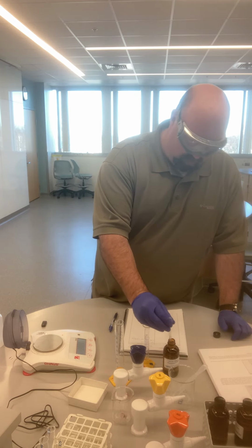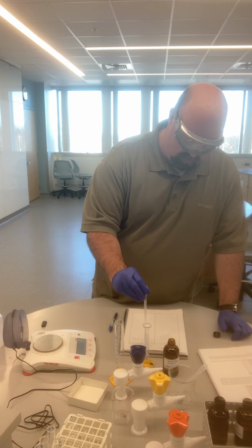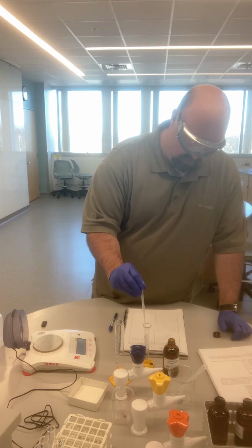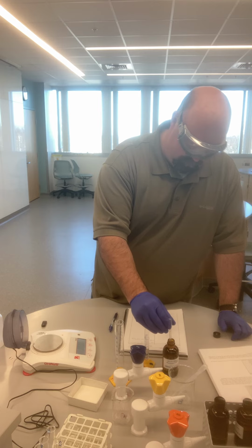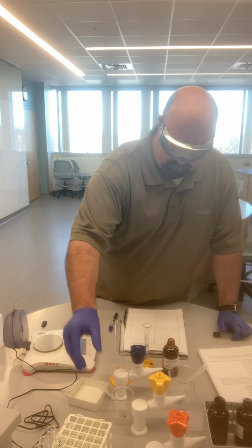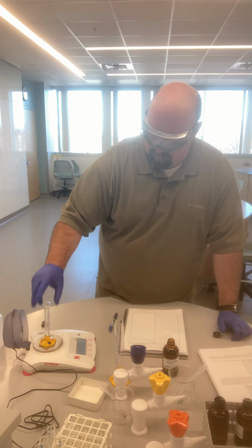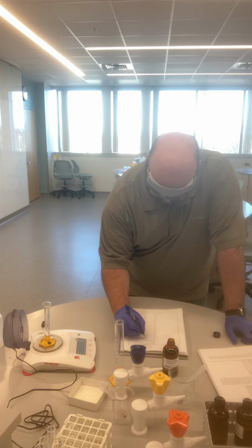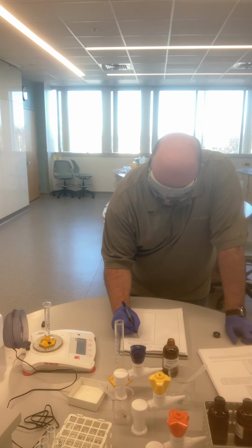Just go with a few squirts of the pipette here. Get some in here. Place this back on the balance.